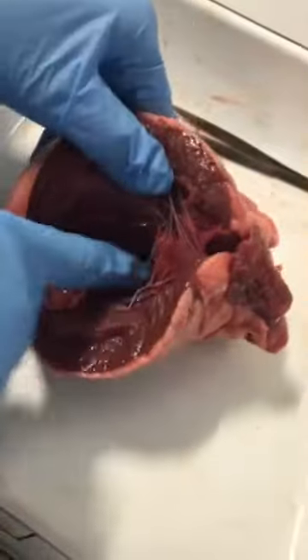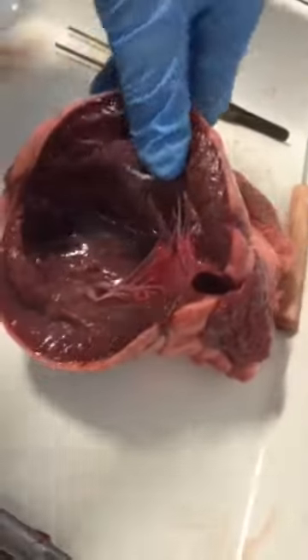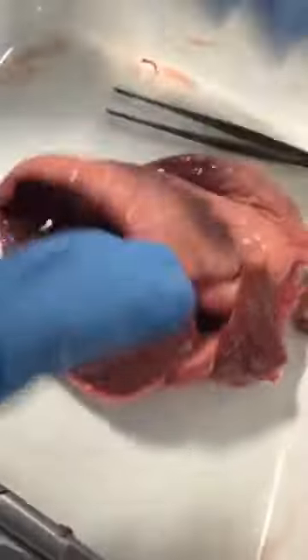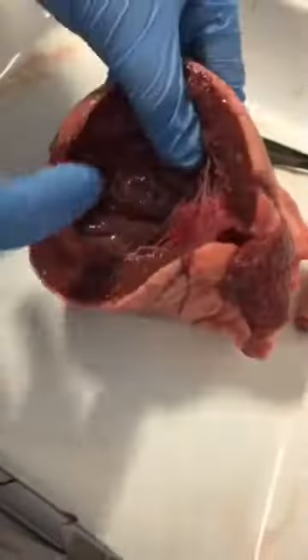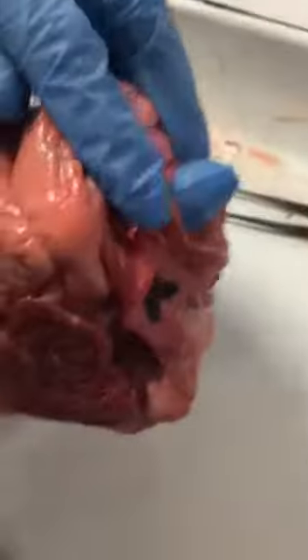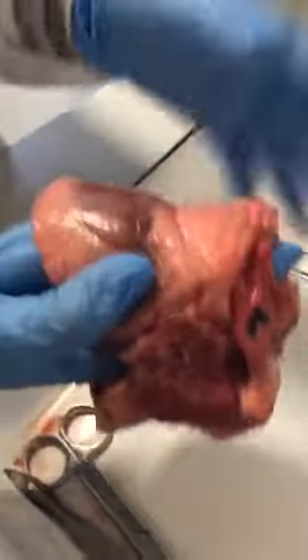And also the septum, you can see it on both sides, is in the middle of the heart, which prevents the left hand and right hand side of the ventricles from mixing together. And then from the left ventricle, the blood flows up into the aortic valve to the aorta, and this takes the blood to the rest of the body.